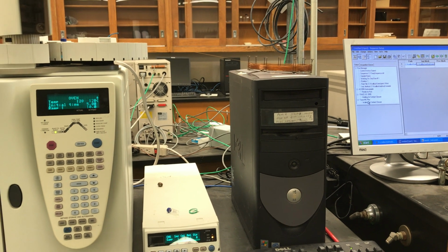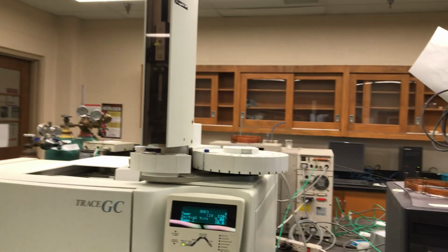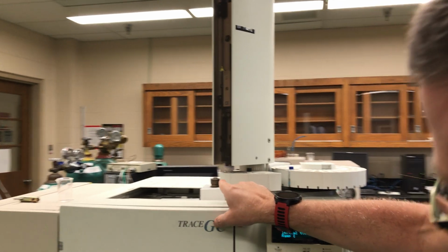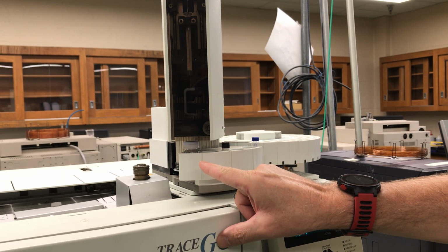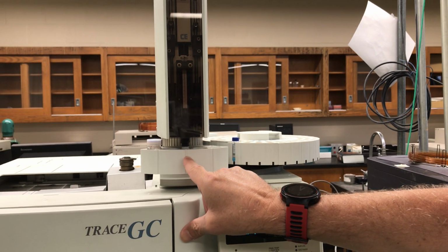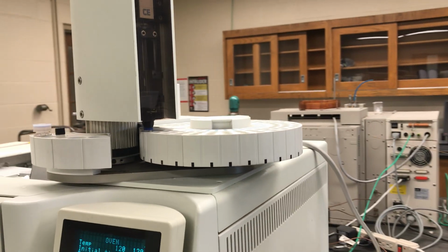Okay, so now the GC is ready and we're waiting for contact closure, which means we're waiting for injection. So now we watch the injector. It's checking its position here. Now it's moving over to the solvent and it's going to bring up a syringe full of solvent, as we directed it to do, to rinse the syringe. We're then going to move to the waste position and inject into the waste. Now we're going to come back to the sample again, and we're going to do our pull-ups.